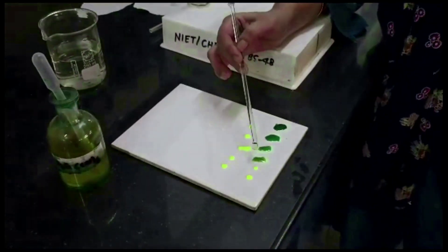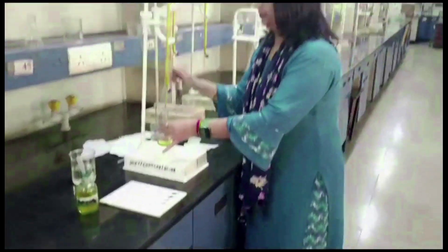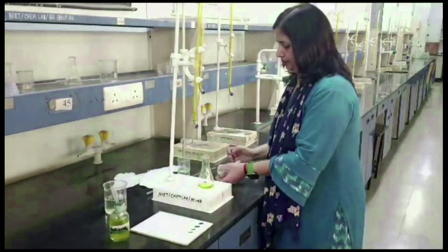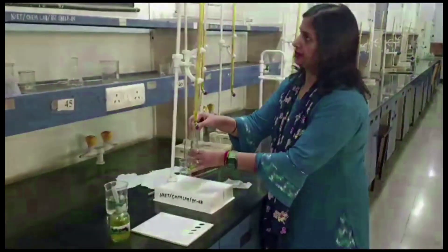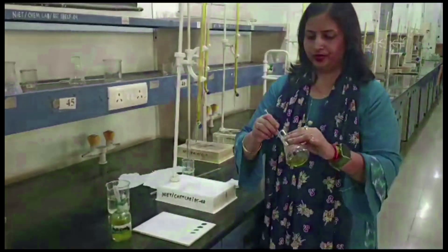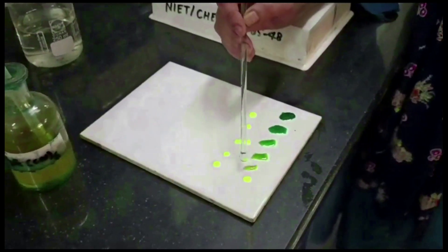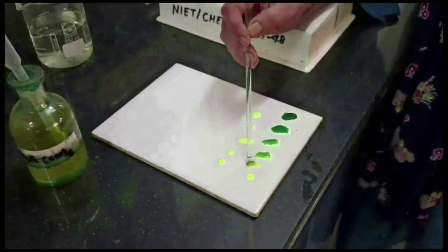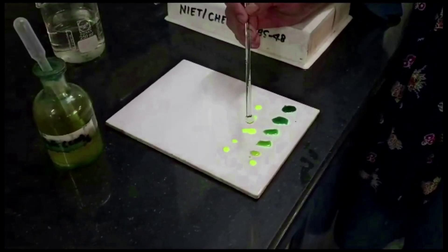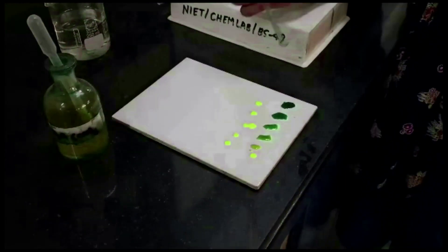Ferrous ions are still present, so the blue color keeps appearing. But now you can see the blue color does not appear. This means all the ferrous ions have been converted into ferric ions. This is the end point.